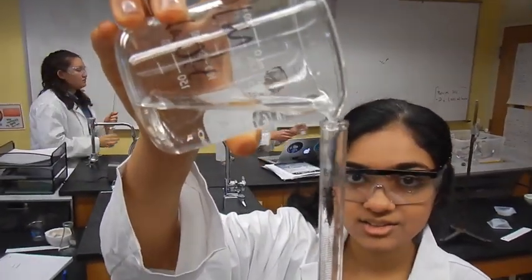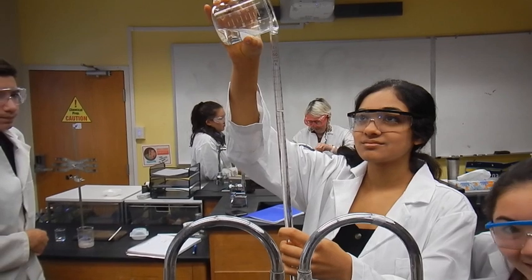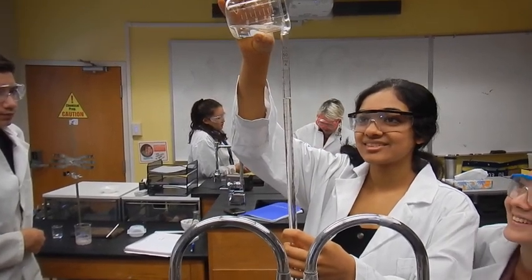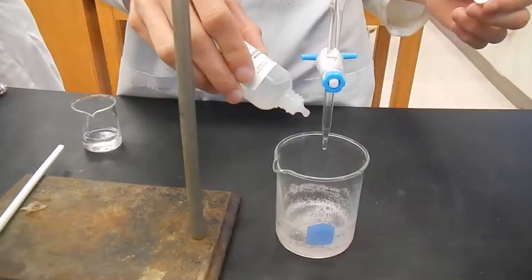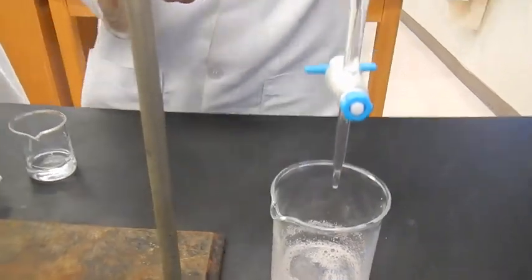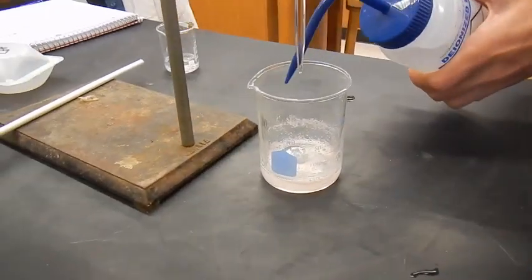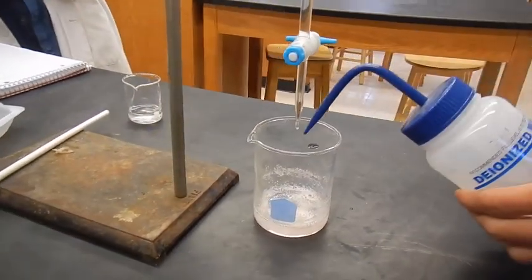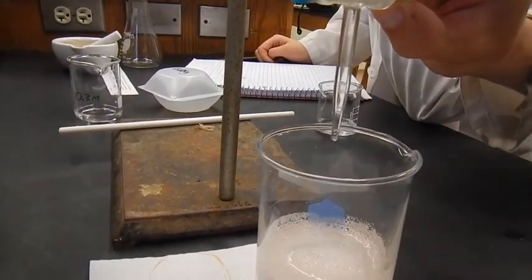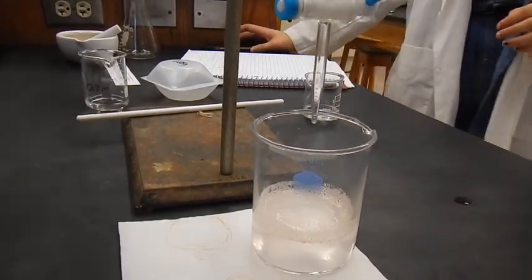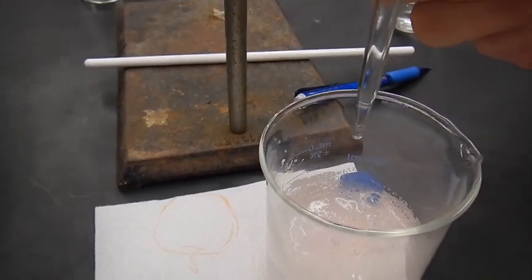Here. Let's... Are we going to stop again? I don't know. How do I know when to stop? Second? Second? I don't know when... How much is this? Oh, they're 2-0. 2-0 too. Oh, no. Oh, do the thing. Do you want to stop? Do you want to stop? I think so. I don't know if so. I don't know if so. That looks great. Oh, oh. Yeah. All right. Wait, is that... I think we need more. Yeah. Oh, yeah. Stop there. And then record the volume. And then refill.